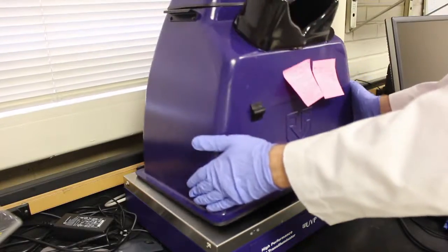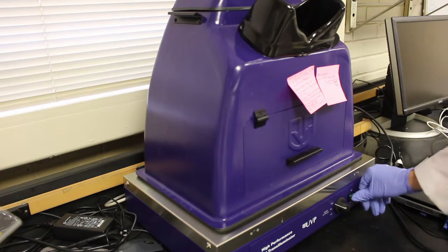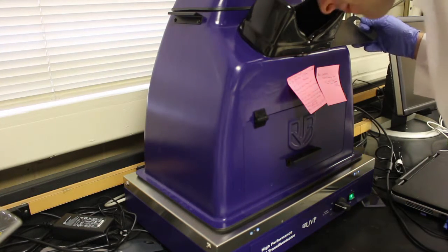Cover the emitter and turn it on. Only view the gel through screens designed to block UV light. Ultraviolet radiation can cause burns to the skin and cornea of the eye. Please use precaution.